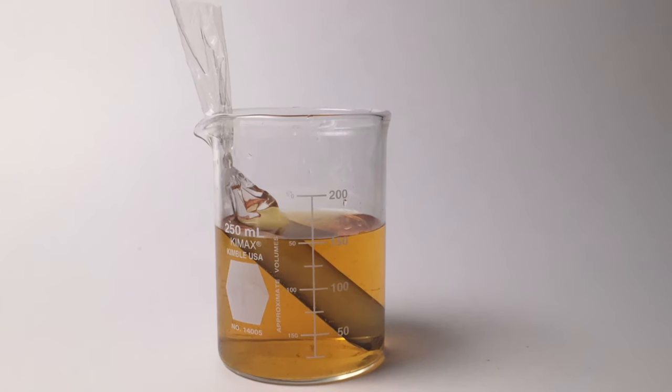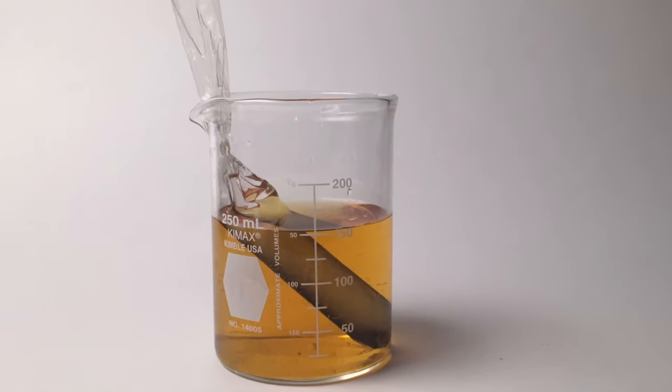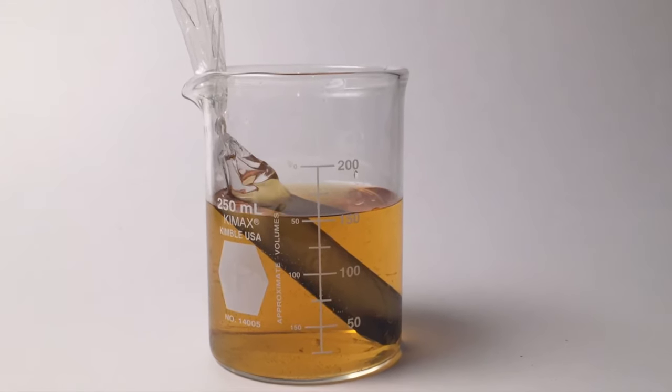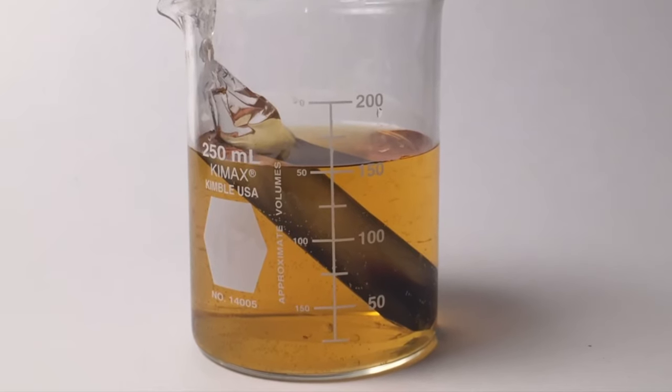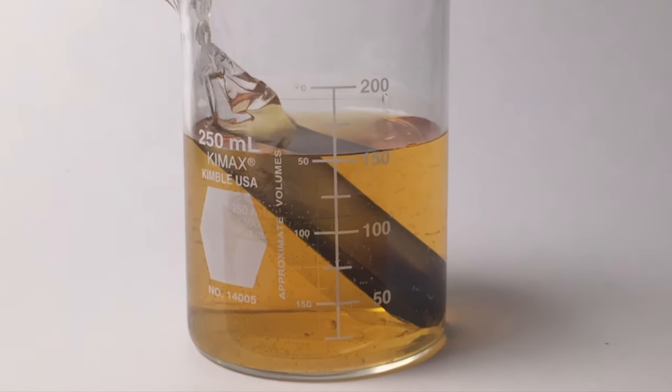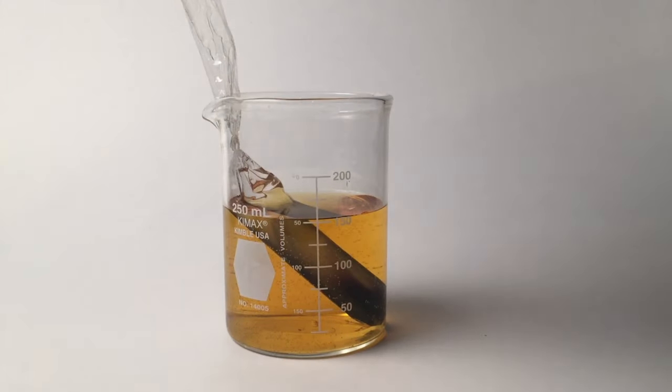So now I'm going to let the bag sit and immediately I can see a color change occurring. This is sped up by the way. And the bag is turning a purplish, blackish color. So let's analyze our results.